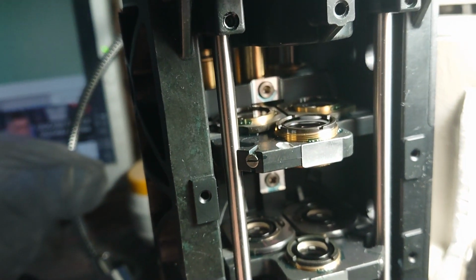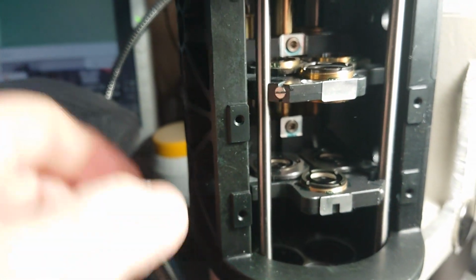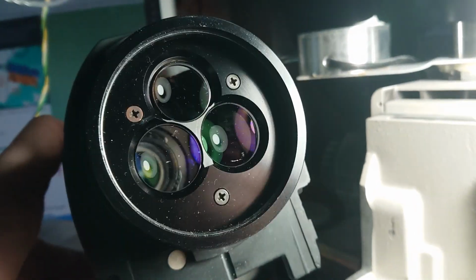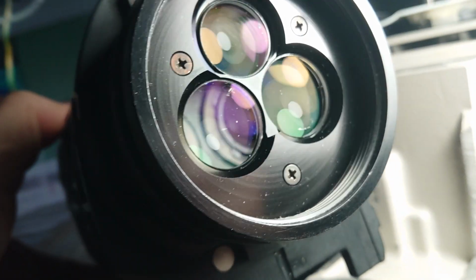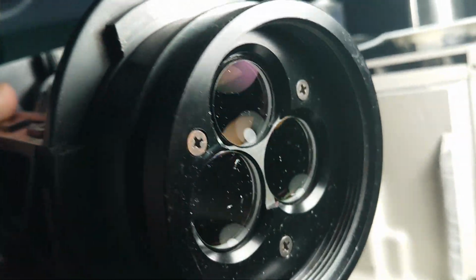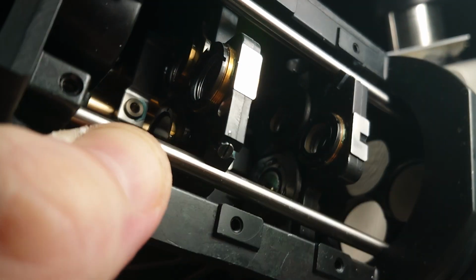So let's see what's the alignment of the one, and we would try to check its resolution a bit. You can see huge lenses here. It has some issues with the glass, so I bought it for very low cost, and I will use it for my own needs. And you can see a very high quality of making.